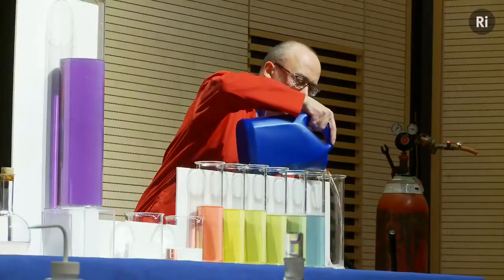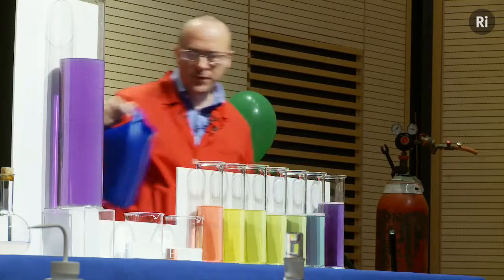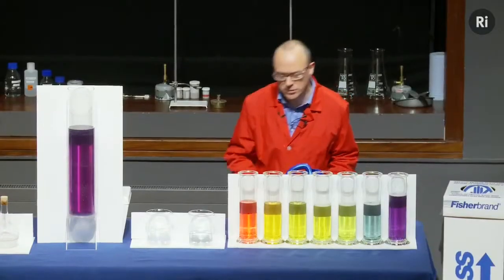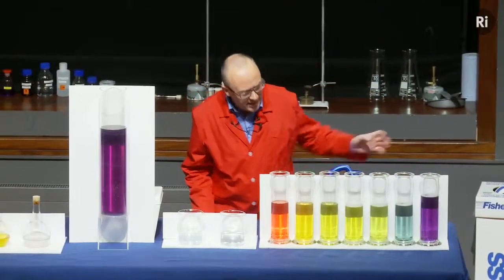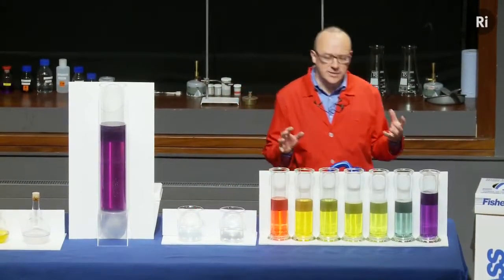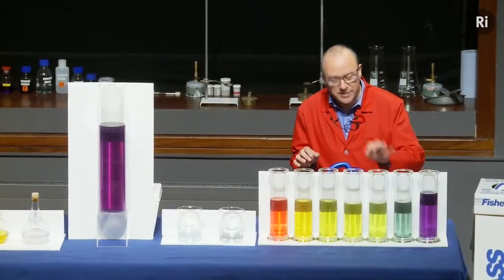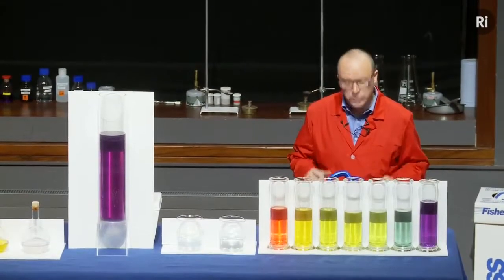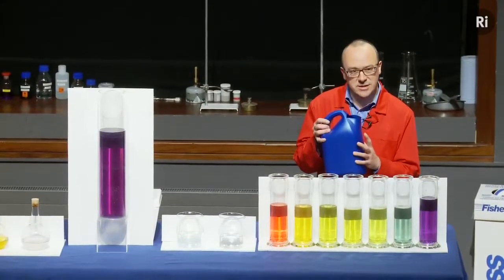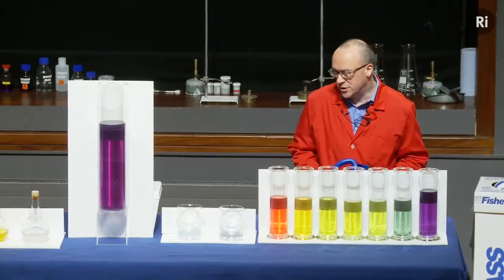So, in the dictionary, the word curious is defined to mean something which is puzzling or surprising or unexpected. And this demonstration might seem rather puzzling at first, until we realised that the cylinders were not empty at the start. Each of them had a little speck of chemical which reacted with the liquid in this container, and it produced a colour change. We'll look at the chemistry of that in just a moment.